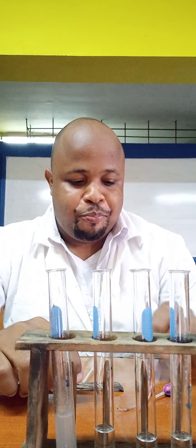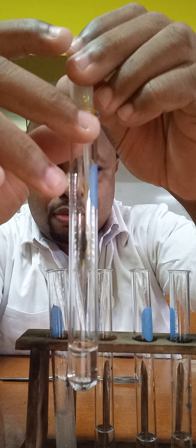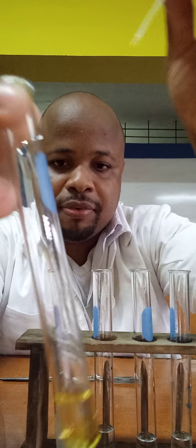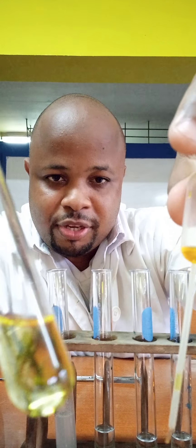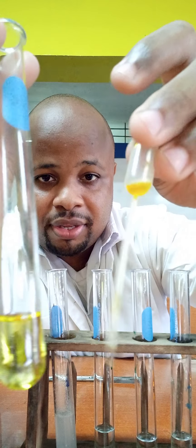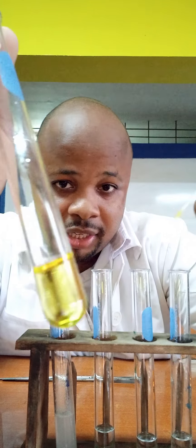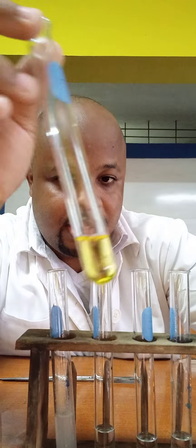The next reaction is going to be with potassium dichromate — specifically acidified potassium permanganate and acidified potassium dichromate, where the acid used to acidify is sulfuric acid. Let's add a few drops to liquid B — one, two, three, four, five. As you can see, nothing changes. The color of the dichromate appears yellow here but it's actually orange, and it stays the same.